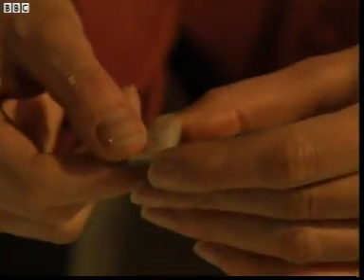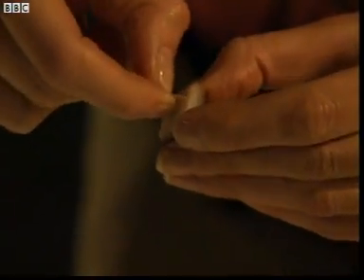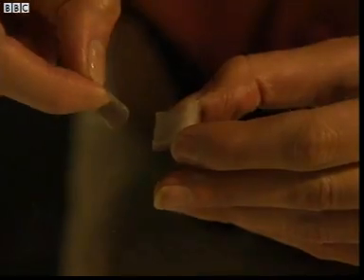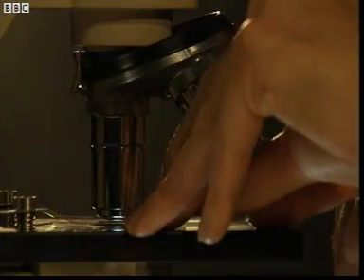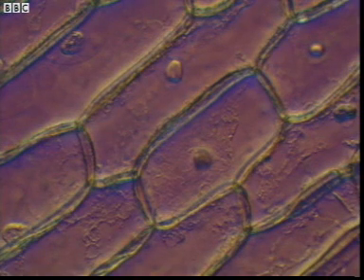To find the right layer, you need to cut a few centimetres into the onion. And if you look at one of these inner layers on about 50 times magnification, you can clearly see the cells.